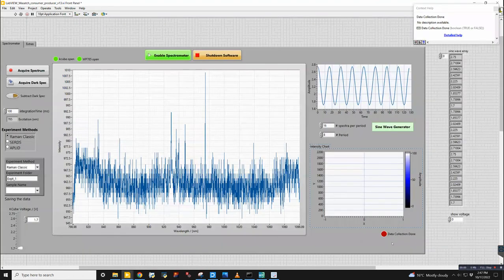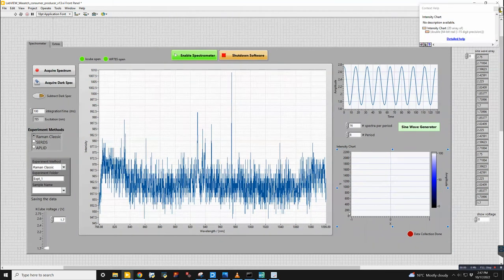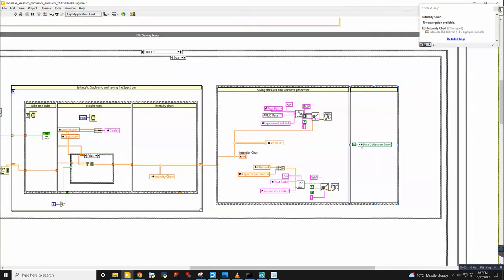So this is a light that I guess is blinking or on when applet is running. Takes a little while, so it's nice to have that feedback from the software to let you know that it's doing something and it's not just frozen. So then once it's saved, then it goes over here.